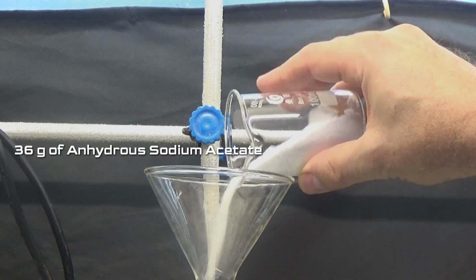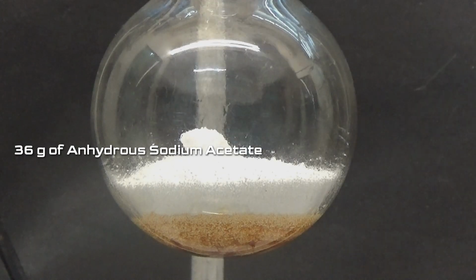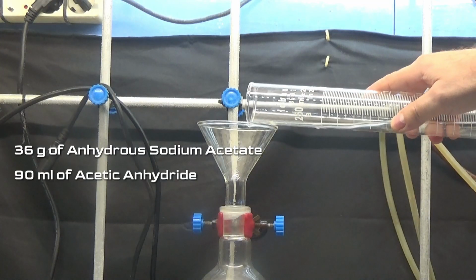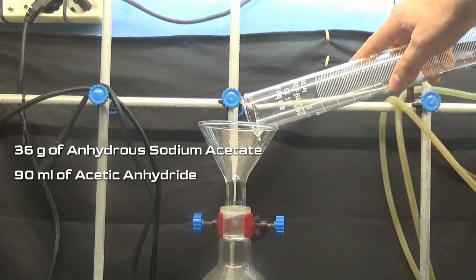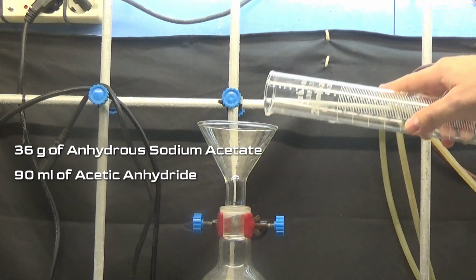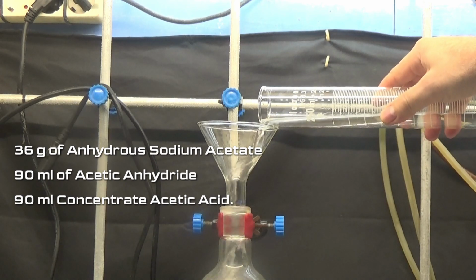In the same flask as the acid, add 36 grams of anhydrous sodium acetate, 90 milliliters of acetic anhydride, and 90 milliliters of concentrated acetic acid.